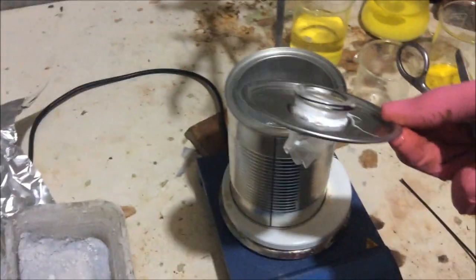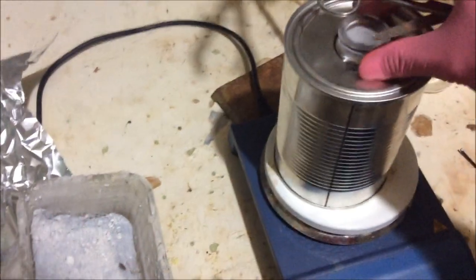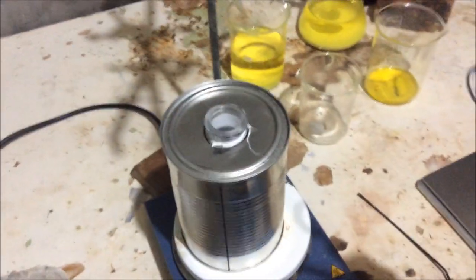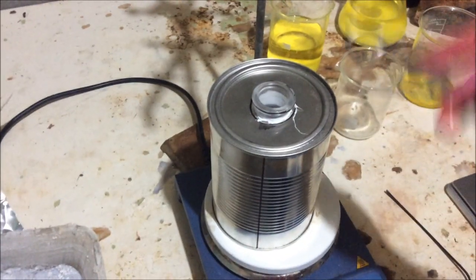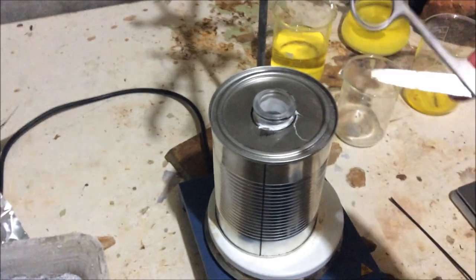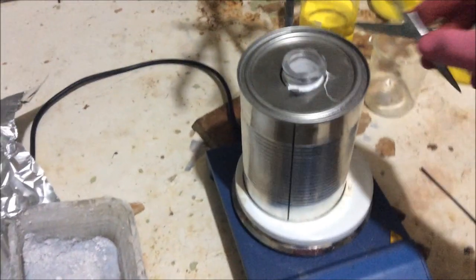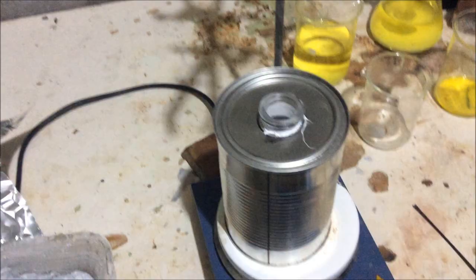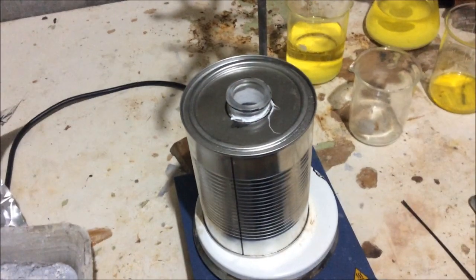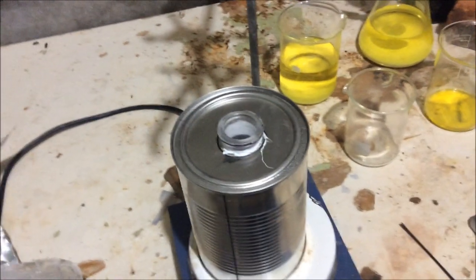So we have the lid here. In there is the neck from one of my 250ml round bottom two neck flasks that I broke during the nitroform video. And this will allow us to now stick a condenser on, but also later put the whole distillation apparatus out of this. But that's a little while away. We'll get the condenser working. Hopefully the smoke and the smell dies down a bit.